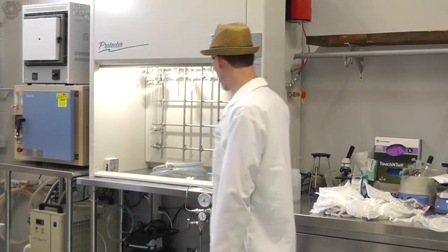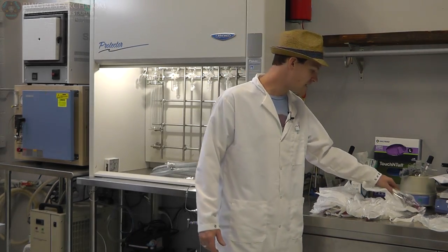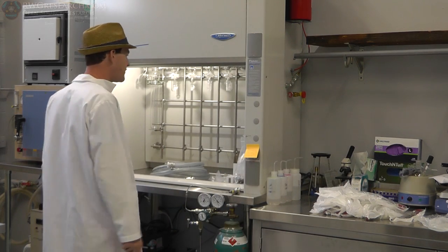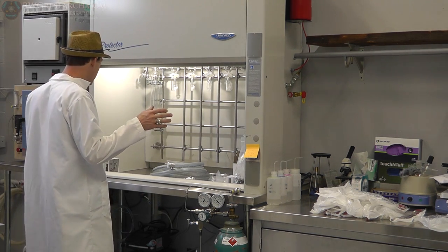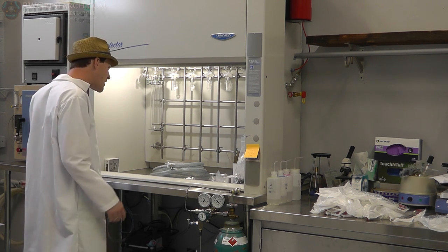So I've got most of the parts here, the plumbing for the vacuum and some of the attachments to hold the glassware. And I think what we're gonna do today is try to finish assembling this thing and finish this video about it. So we're gonna work on the vac, possibly hook up some of the other stuff, put the grease on the fittings.